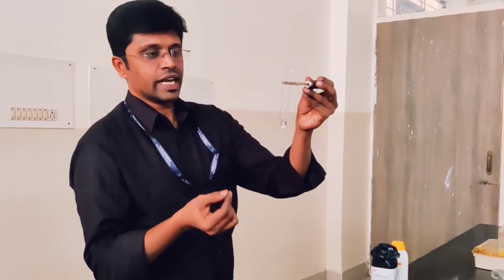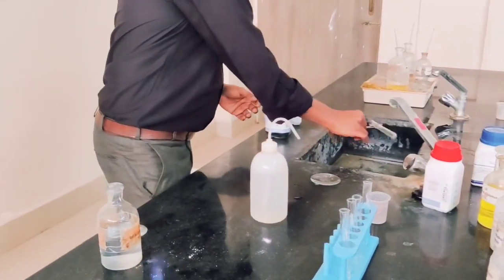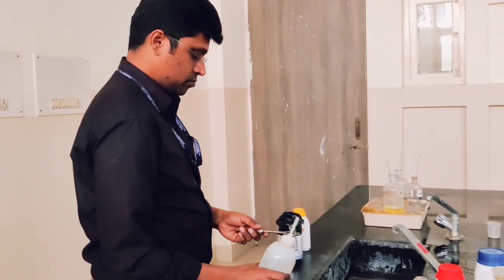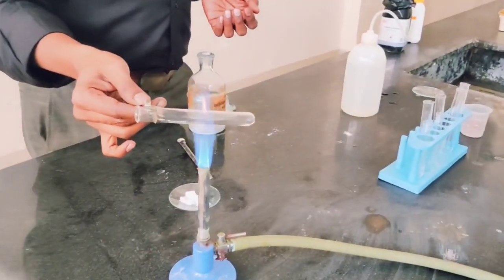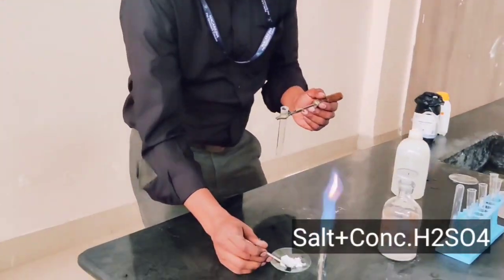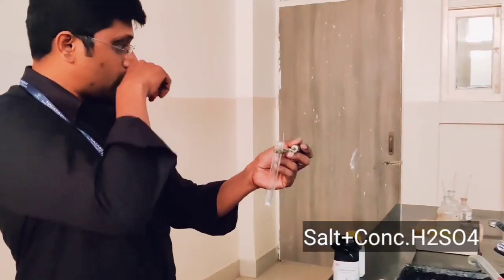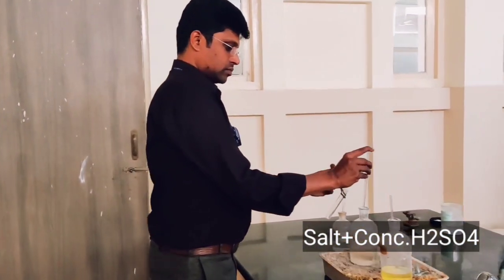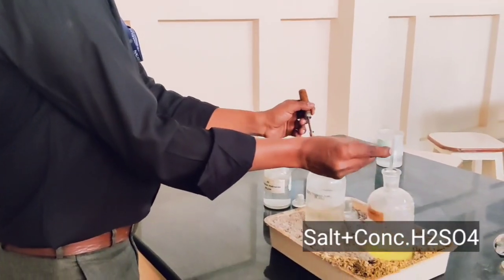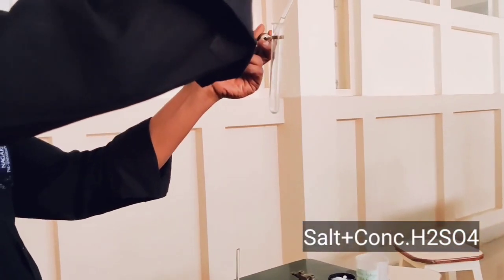Now we can move to the second group, which consists of three acid radicals: chloride, bromide, and nitrate. For the second group we have to use a dry test tube, as we are using concentrated H₂SO₄. We add a pinch of the salt and add concentrated H₂SO₄. If fumes are coming, it indicates the second group.